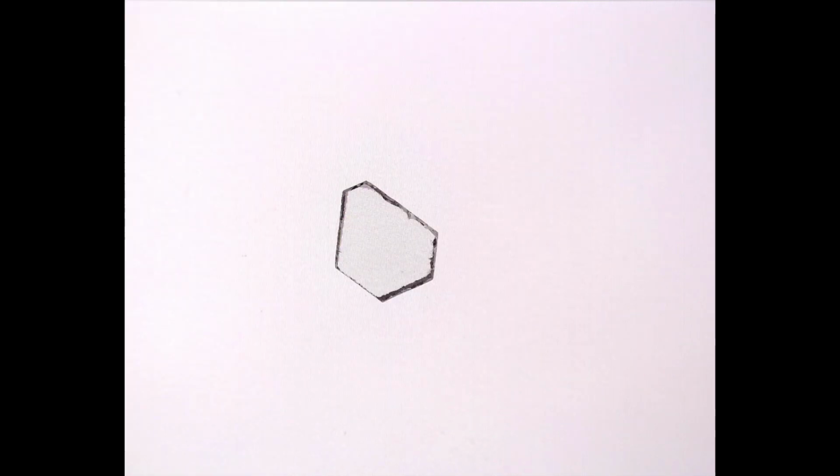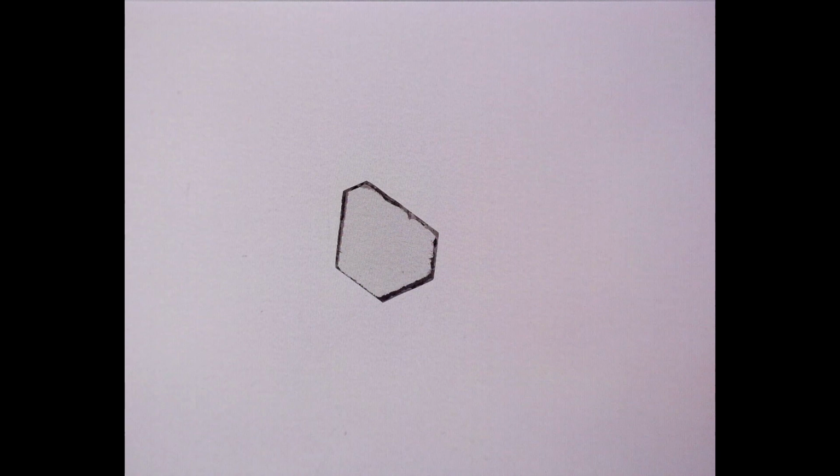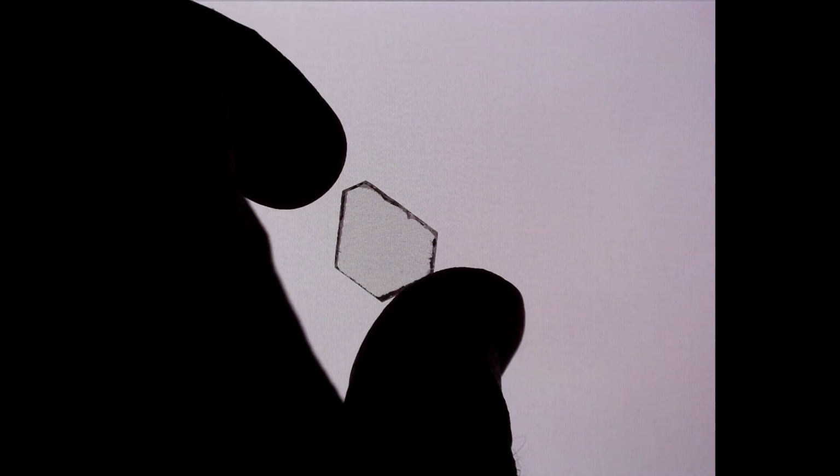So our simple clear quartz slice actually has quite a few different interesting things going on that you can tell just using some basic techniques of optical mineralogy. And now that we know the phenomena going on with our clear rock crystal slice, let's actually take a look at some of our other varieties of quartz as well.